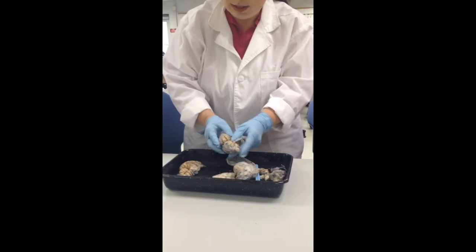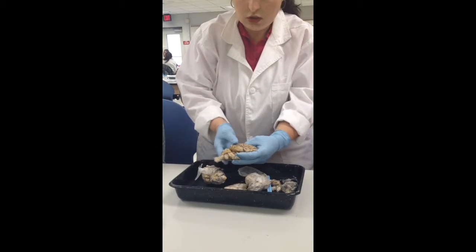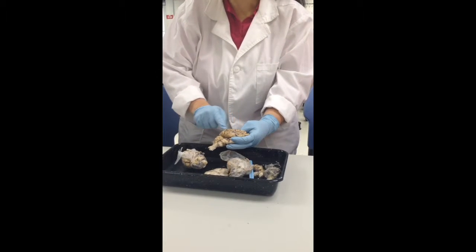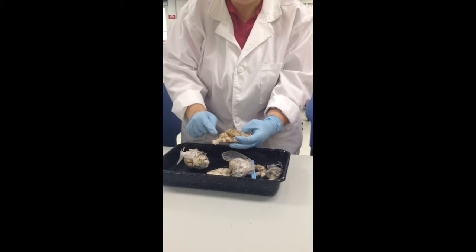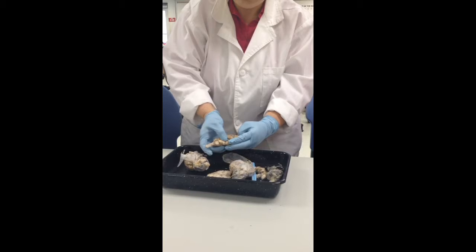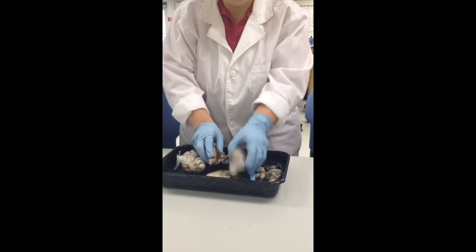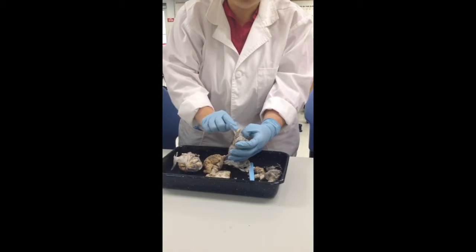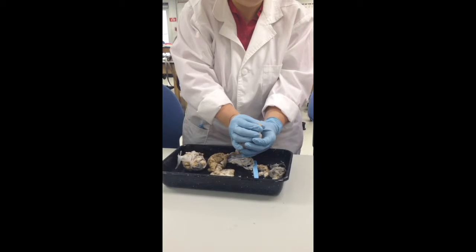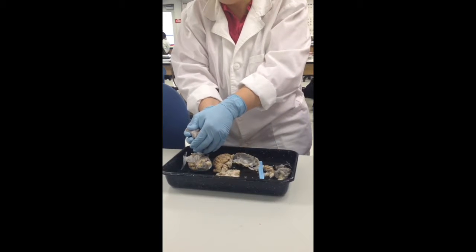Okay. All right. As we look at the brain, we've got major regions. So this major region is the cerebrum. This one would be the cerebellum. This down here would be the brainstem, and then brainstem extends into the spinal cord. And if you were to look at this section under the dissection scope, you'd see a little butterfly. There's also a little hole down the center. See how that little hole kind of opened up? That is the central canal. So that is flowing CSF.